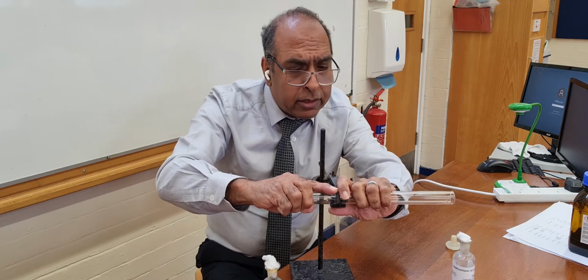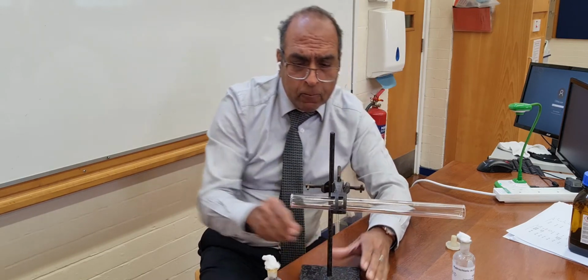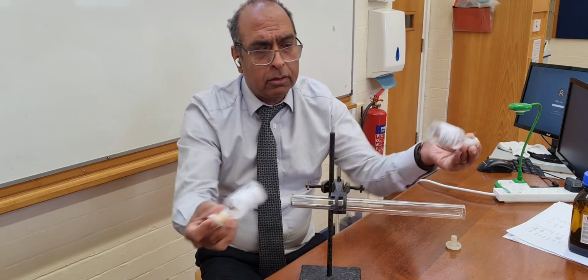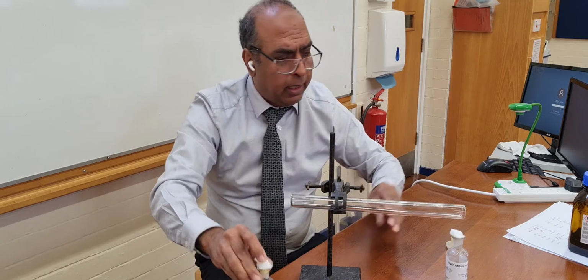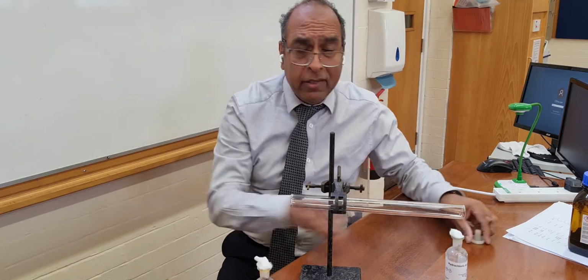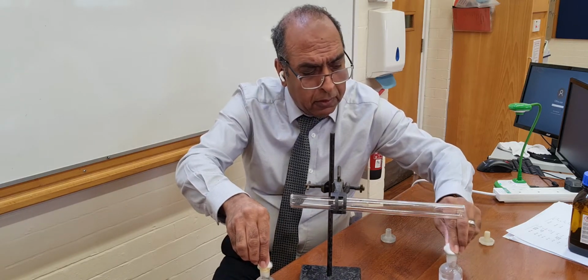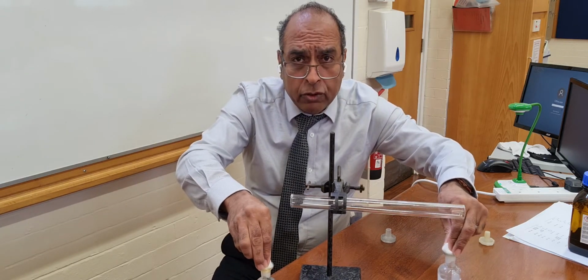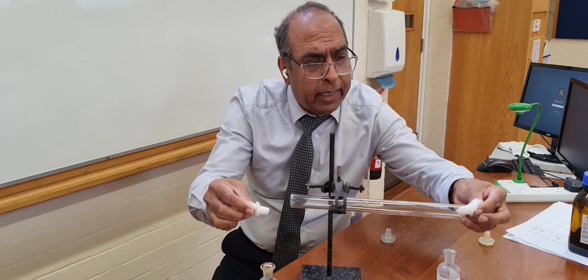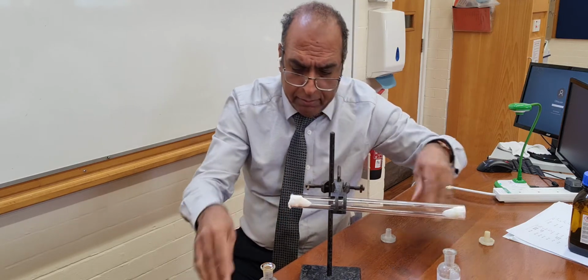Now, if I try and get this level, like that, get the 2 chemicals, put them in, I'll explain what happens. But the key to this is to put them in at the same time, because we want to see the spreading out, the diffusion happening, and link it to rate. So there, I put both plugs in at the same time.